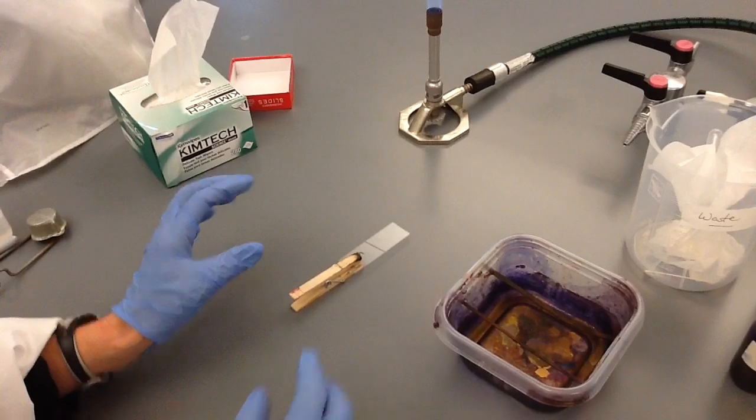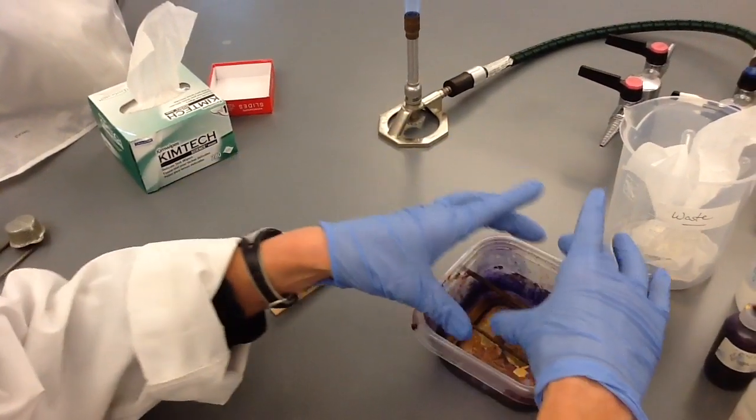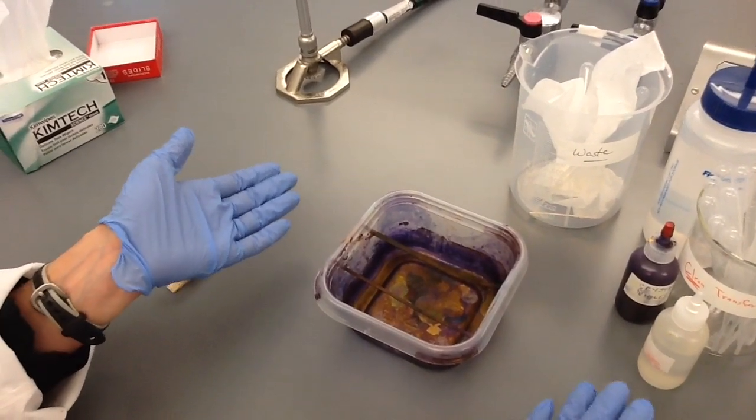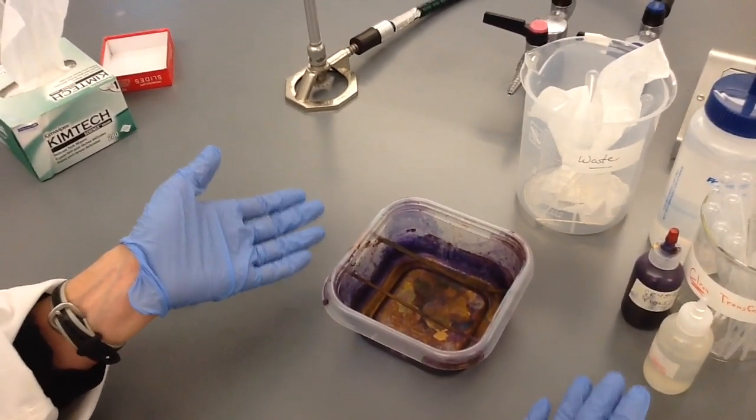When it is completely cool, you take the slide and place it in the slide staining tray and proceed to the next step, whatever kind of stain you wish to apply.